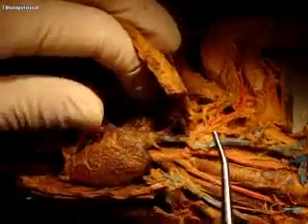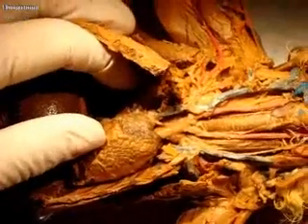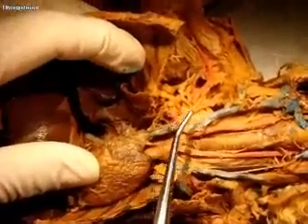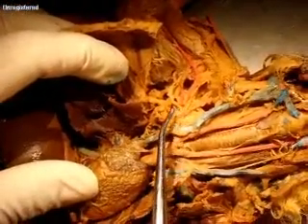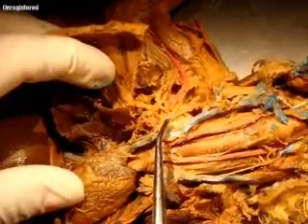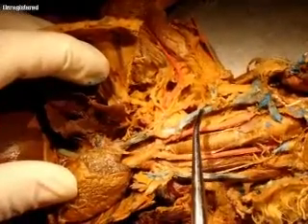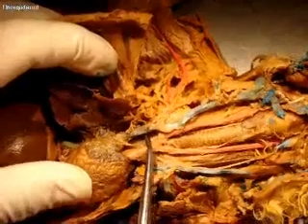I'm not 100% sure because the heart is turned around and we haven't pulled the heart out. You have to kind of see where it's going. You can tell by being blue or red, because blue technically should be a pulmonary vein. But we're not really sure what it is in this case.